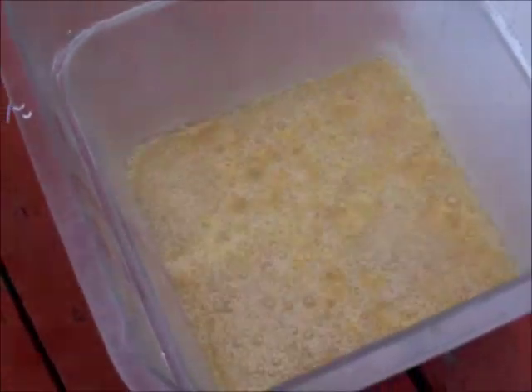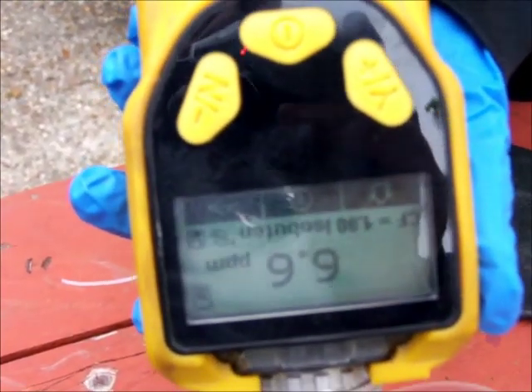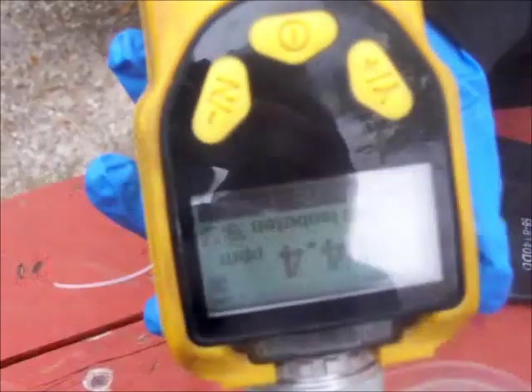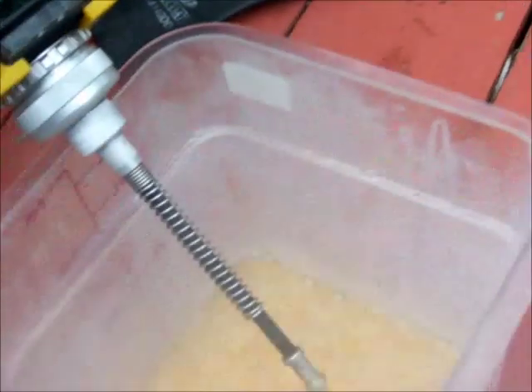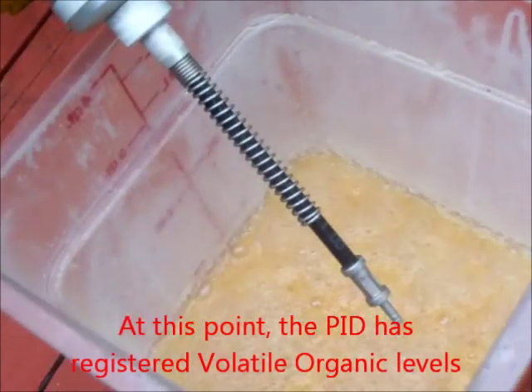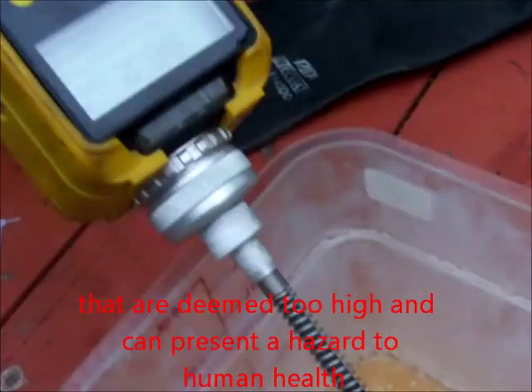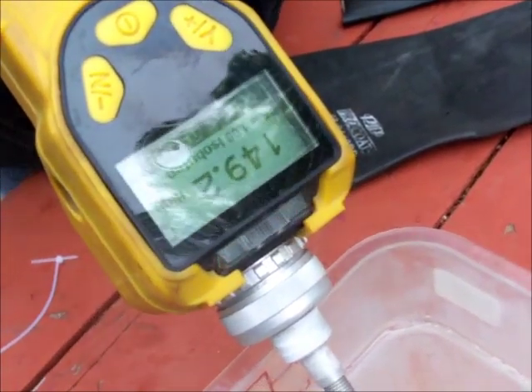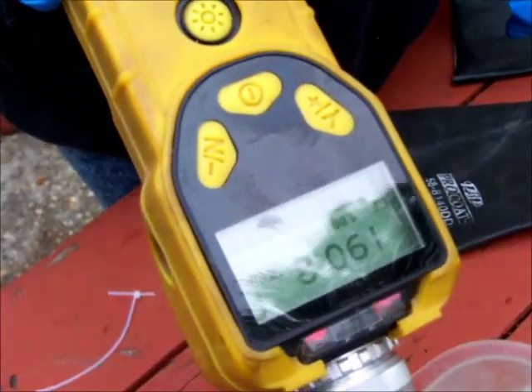The PID's all good — we shall test it again. Look at that skyrocket. It's really starting to smoke now and bubble. The reading is much higher than before and it's still increasing. That high-pitched buzzing noise really hurts my ears.